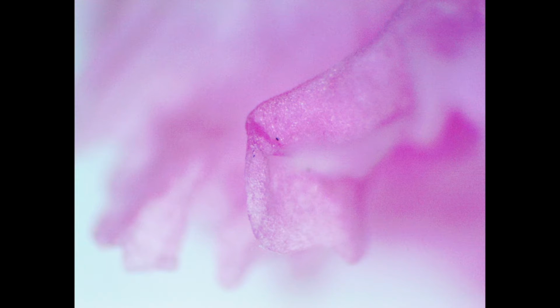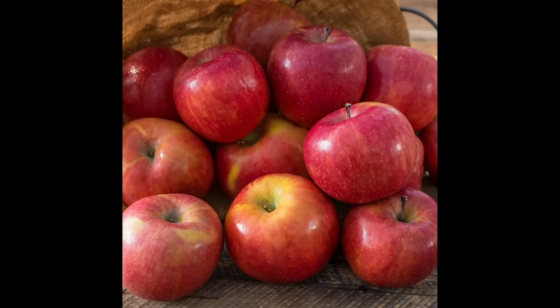Our next object looks like this under the microscope. And as we begin to analyze the following images, we discover it's the flesh of a flower petal. Speaking of flesh, these next microscopy images appear to be very wet and juicy. That's because they are composed of 85% water. Still can't guess what it is? Let's take a look at these images from another part of the object for some hints. You guessed it, an apple.